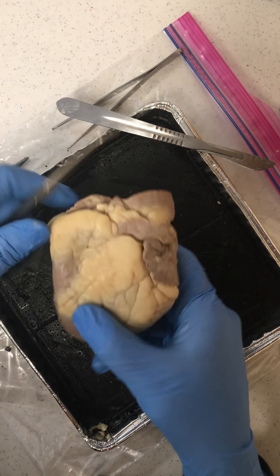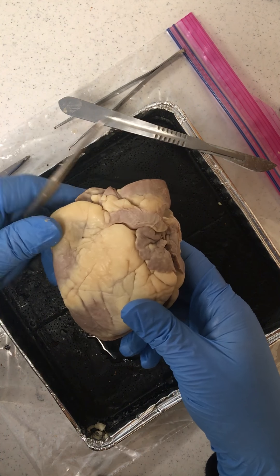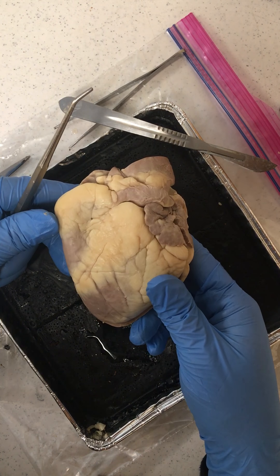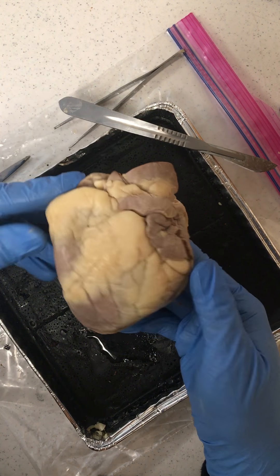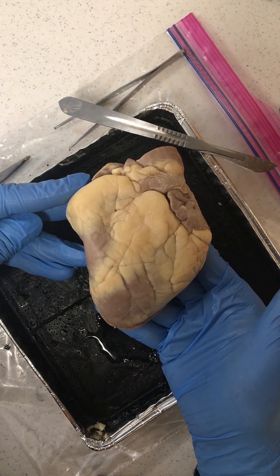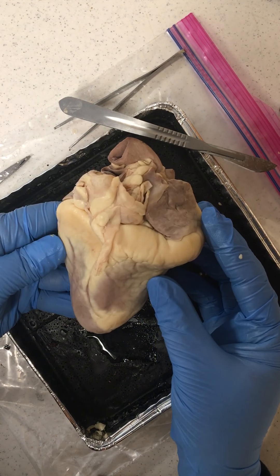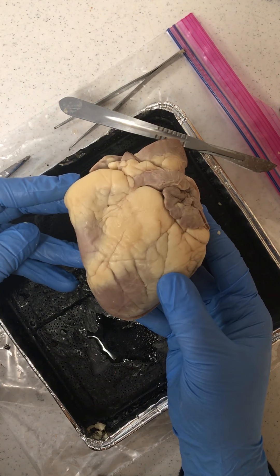Ultimately that blood travels out throughout the body — the brain, the arms, and through the systemic circulation. So there you have it. That is the sheep heart dissection for North Dakota State's paramedic program. Thank you.